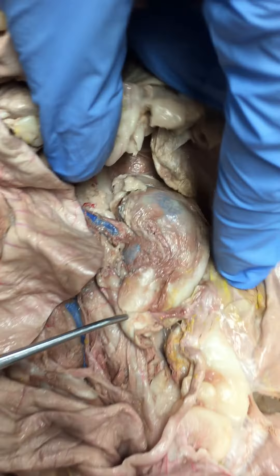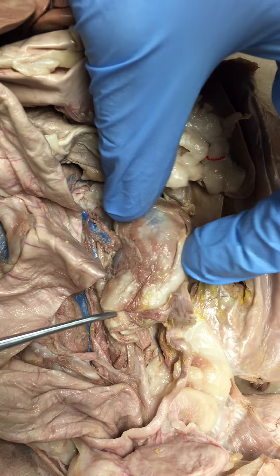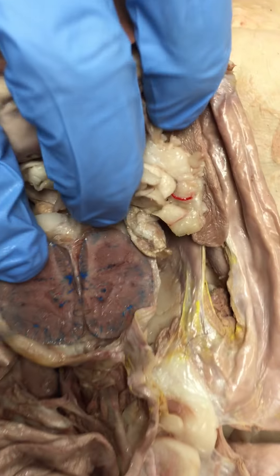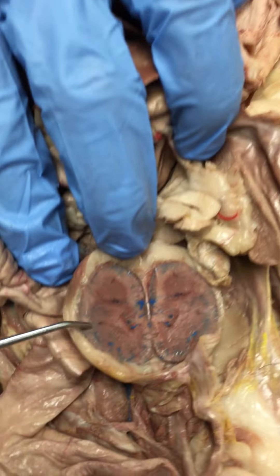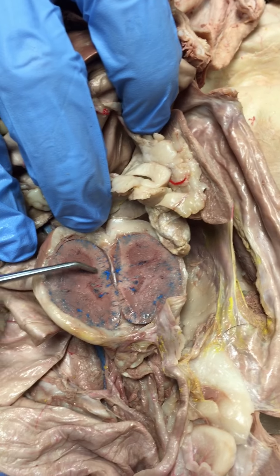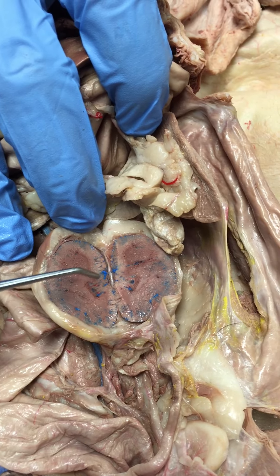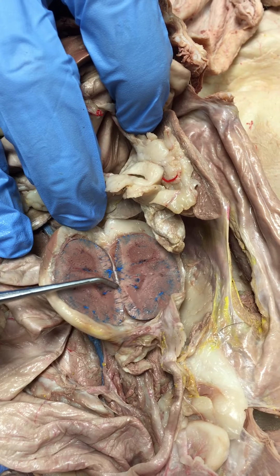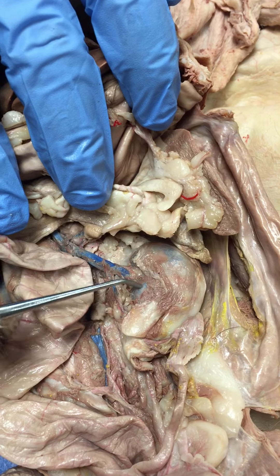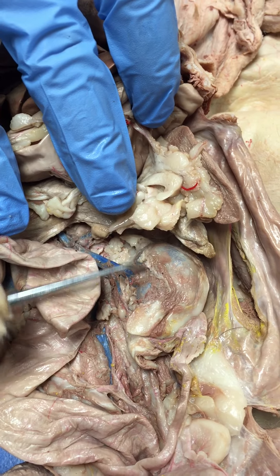Then we go to this big structure which is the kidney. We will flip her open. And we have the outside region right here which is the renal cortex, and this inside region which is the renal medulla. And we have this region right here which is the renal pelvis. On the outside, this bottom half, this little curve right here is the hilum.